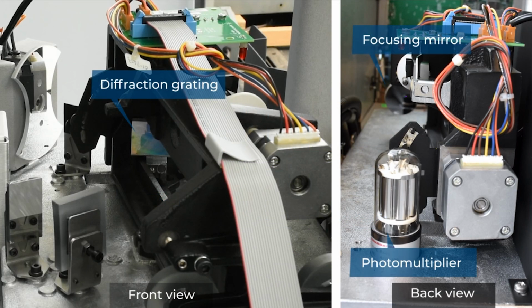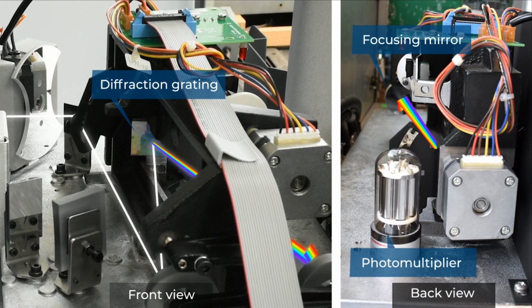Photons enter the monochromator through a small slit and then are reflected off a mirror onto the grating. The grating spatially separates the wavelengths. The dispersed light is reflected off the grating to a second mirror, which both reflects and focuses the light towards the photomultiplier tube. An exit slit right before the photomultiplier tube ensures only a very narrow range of wavelengths can enter the detector.